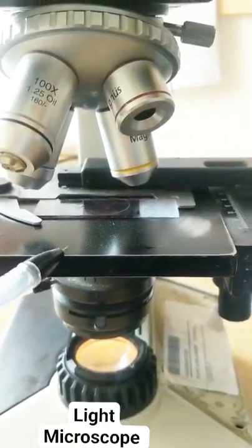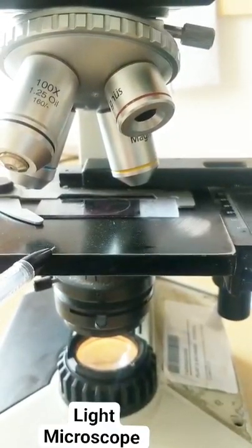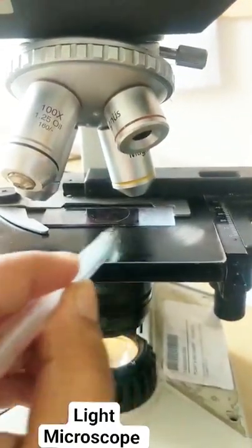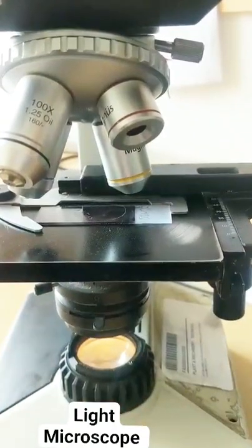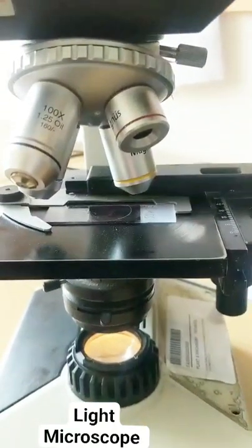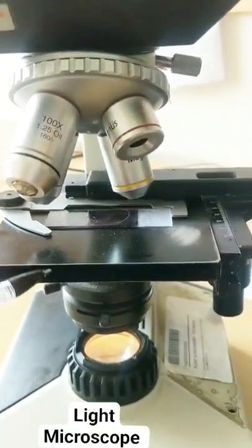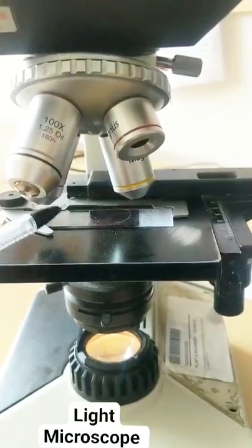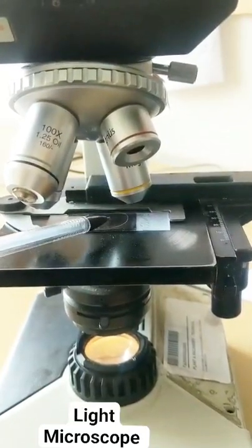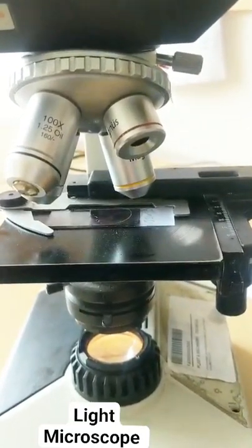Where does the light enter? The light enters over here. This is the stage. Do you notice I've kept the slide on a stage. Now after the light enters, the light comes in contact with — light passes through this slide and whatever specimen you've kept over here.